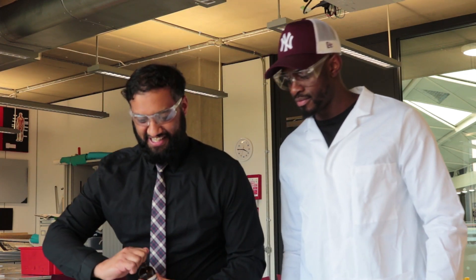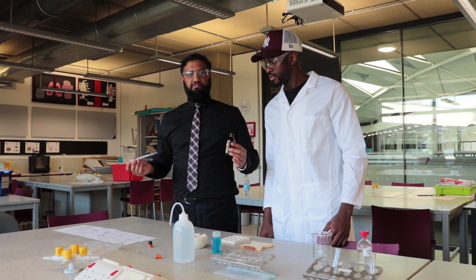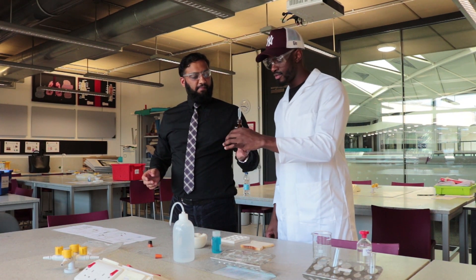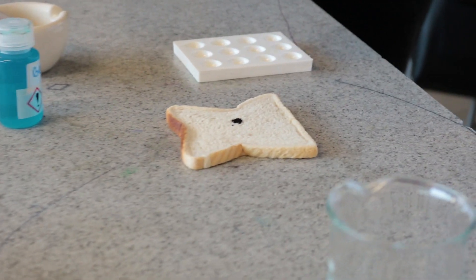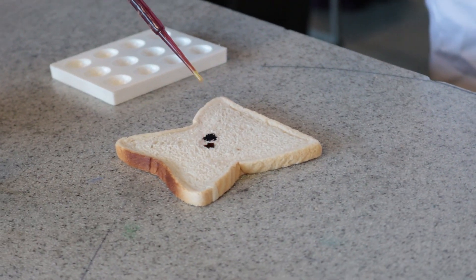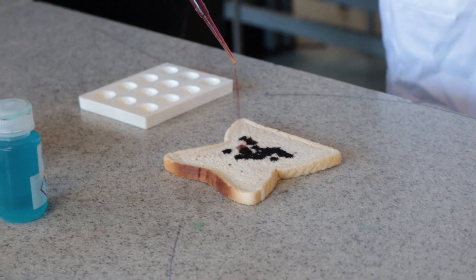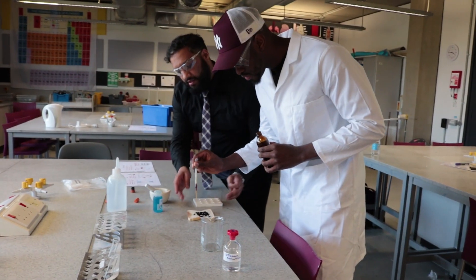I'll open it up for you. If you do get some on your hands, just wash it off - you've got a sink. Here we are. There's a pipette. Iodine. Pipette. Bread. Drop. Oh, blue - put a bit more on. The school's got enough money, you know. You don't have to be that tight. It's changing. What colour is it going to be? Dark blue.